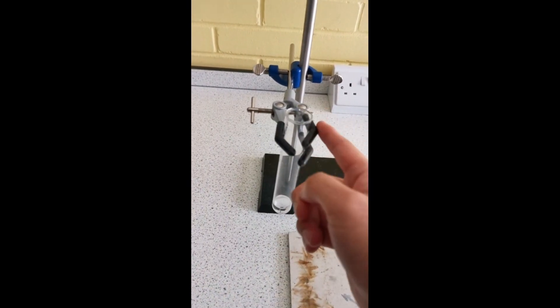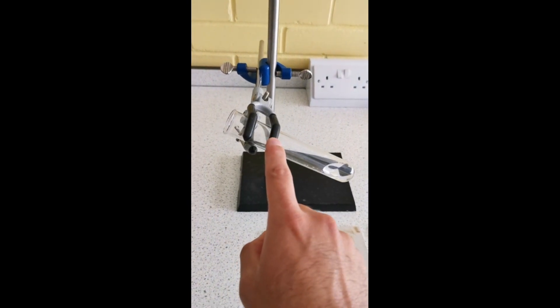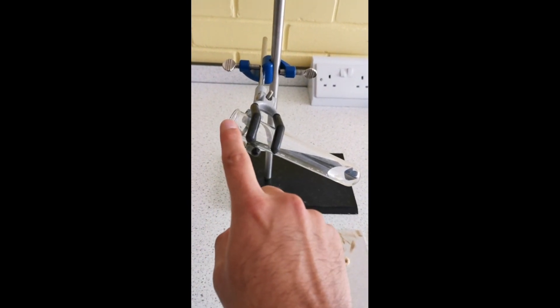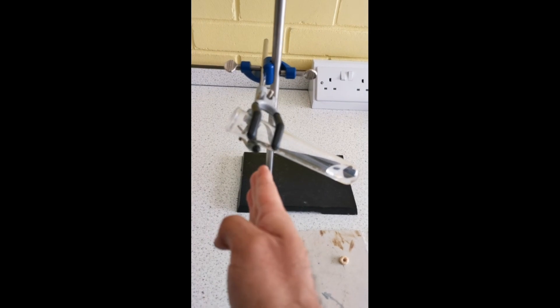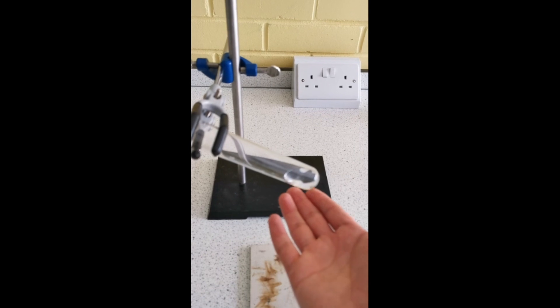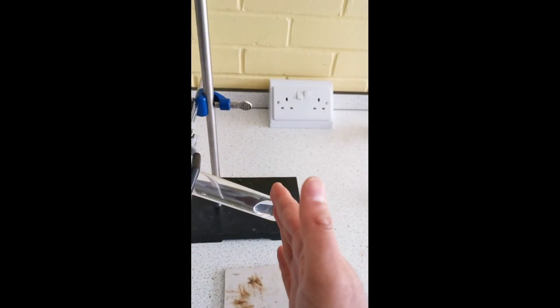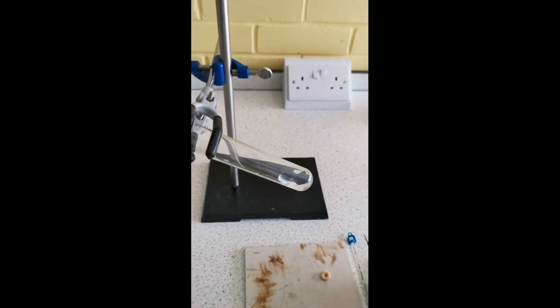That's also why you want your clamp to be near the top of the boiling tube. If you heat it too close, the plastic on this will melt and catch fire. So you want your heat source to be here, above the heatproof mat, with nothing directly above it.